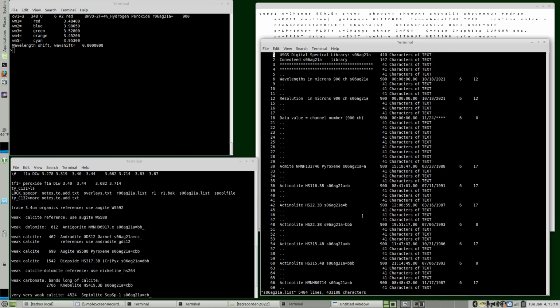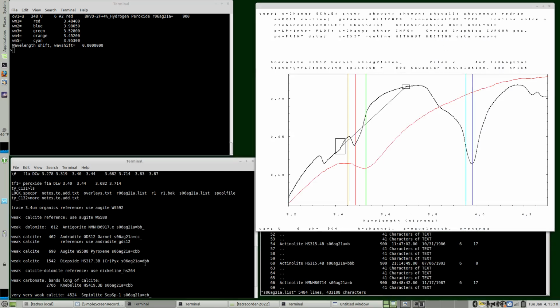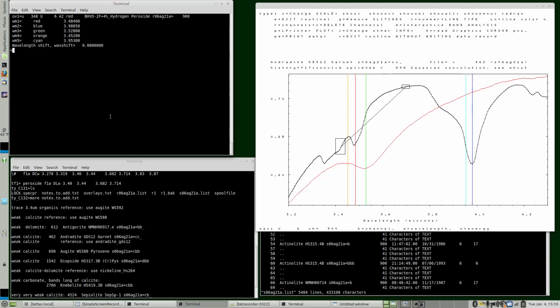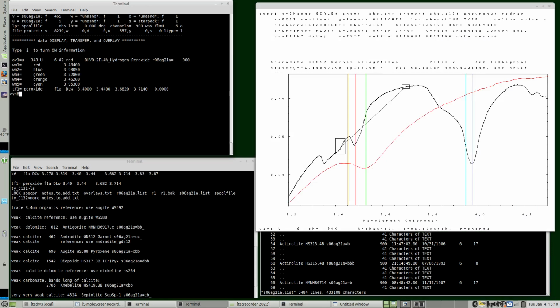So let's look for, we can go through and check all kinds of spectra pretty quickly. When it has 3 letters, that's an IR spectrum. These others are Vis near IR. So let's start at record 48. So V48, we're going to look at all kinds of spectra, and we'll auto scale each one so it fits on the plot and can compare this feature or whatever shows up in the spectra to the hydrogen peroxide spectrum.